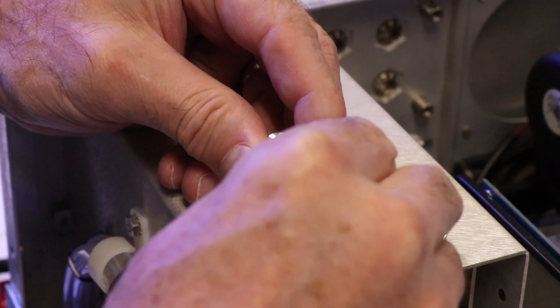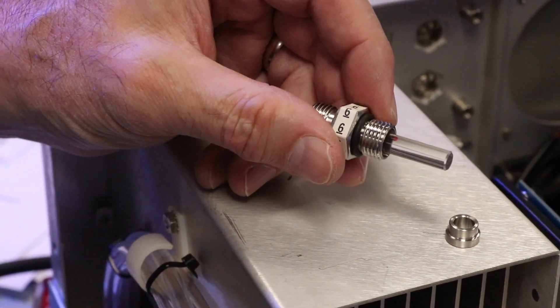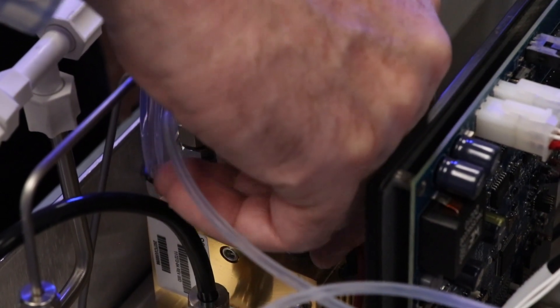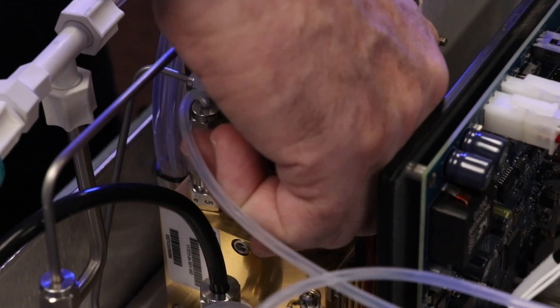Replace the capillary in the reaction chamber, making sure the O-ring is around the capillary before inserting it into the body. Replace the fitting. Note that the fitting should be tightened slightly more than hand tight.